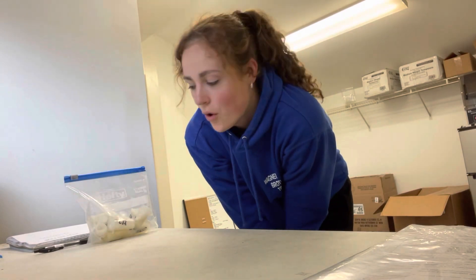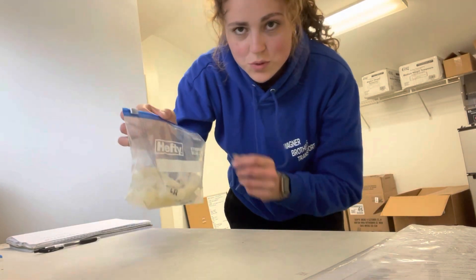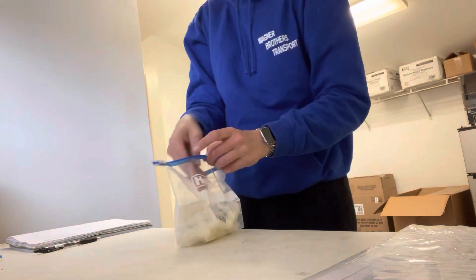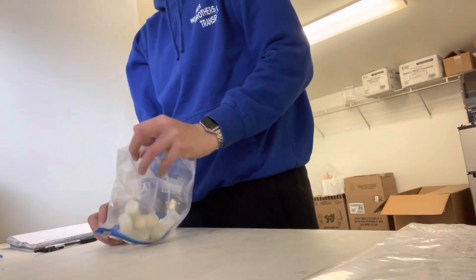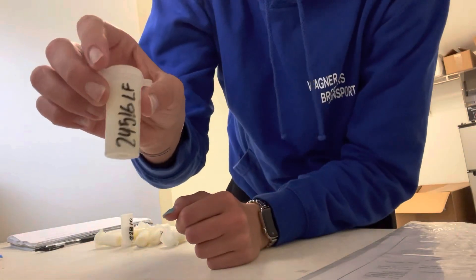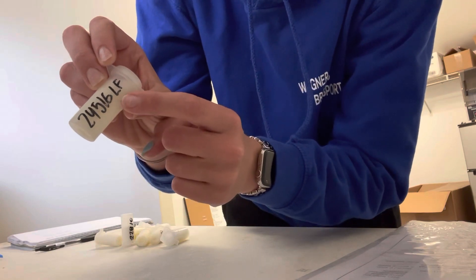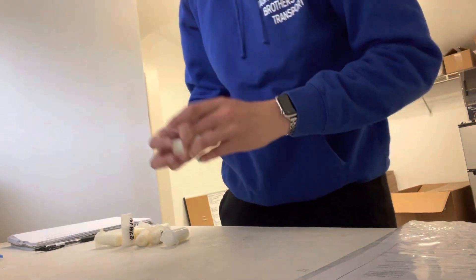Now that I have it all written in my notebook, I'm going to set out the samples in the correct order. Each sample tube has milk in it from the cow that has this number, and then which quarter of the udder it's coming from.